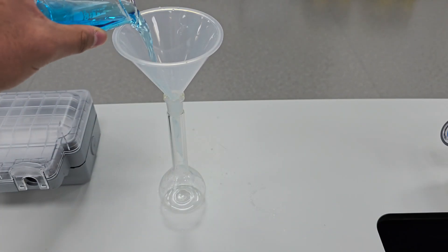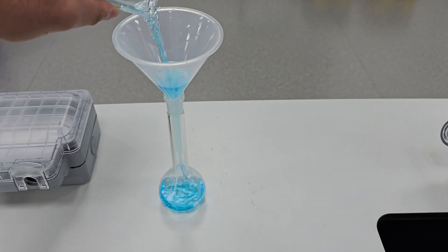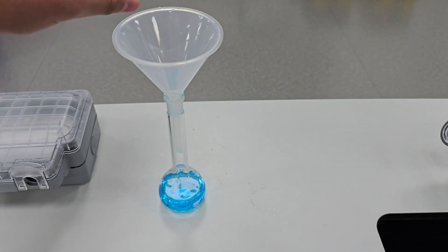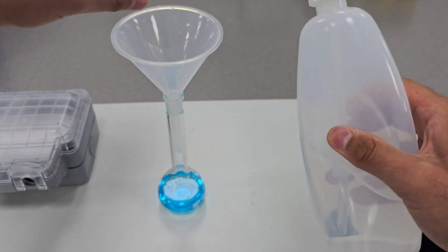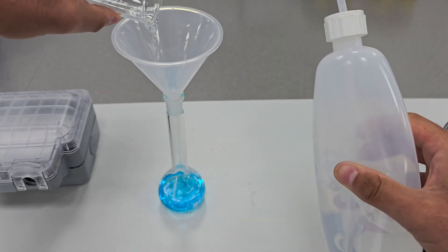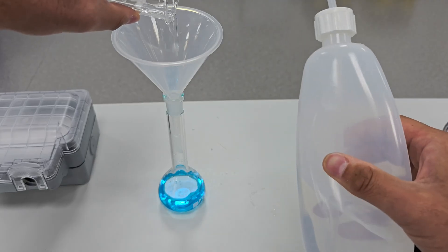Using the funnel, I carefully pour the copper sulfate solution into the volumetric flask. Again I use distilled water from the wash bottle to rinse out the beaker, ensuring that every bit of the copper sulfate solution makes its way into the volumetric flask.